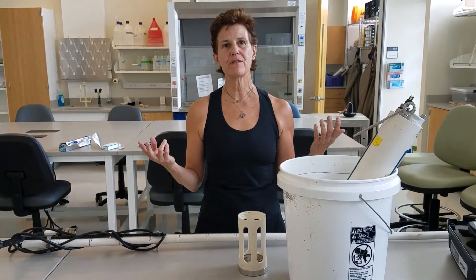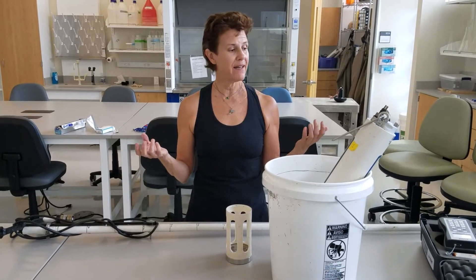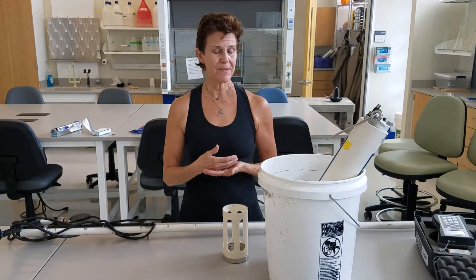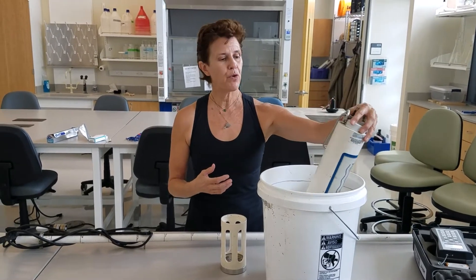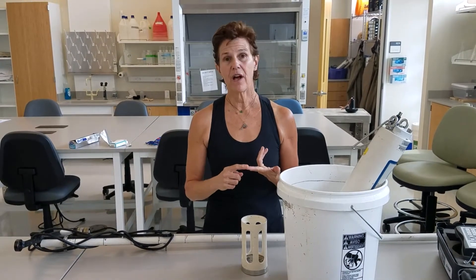There are two pieces of gear we use where you're not collecting a physical sample — you're collecting data. In one case, we use a light meter to determine the clarity of the water, and we use that in river, deeper river, and lake ecosystems. In the other case, we use a multimeter — normally a piece of equipment called YSI out in the field — which allows us to collect pH, dissolved oxygen, temperature, and specific conductivity.